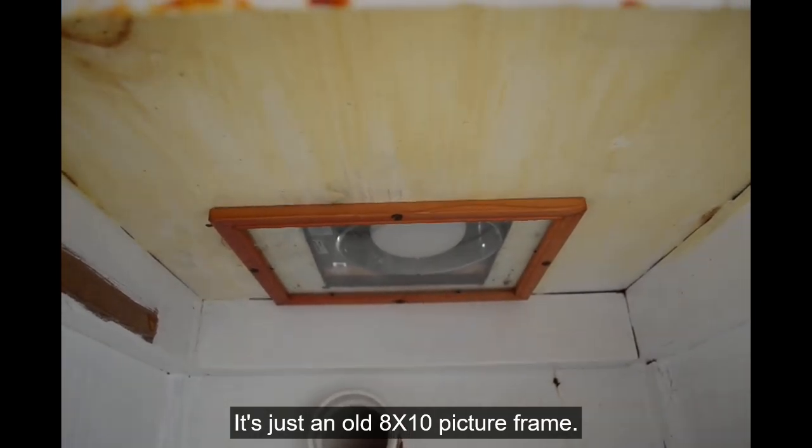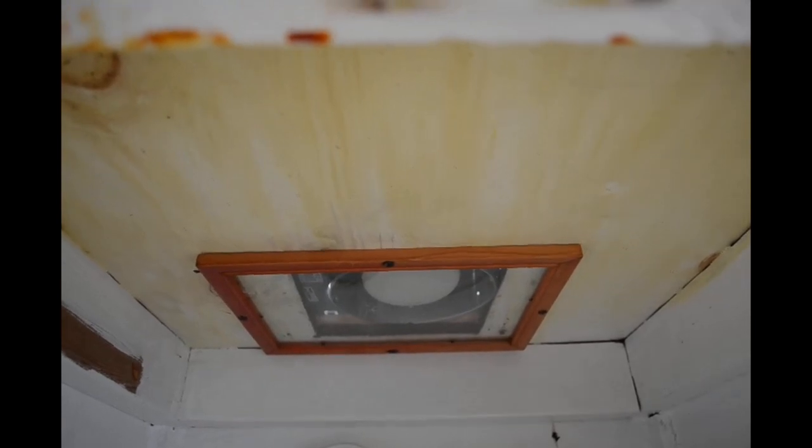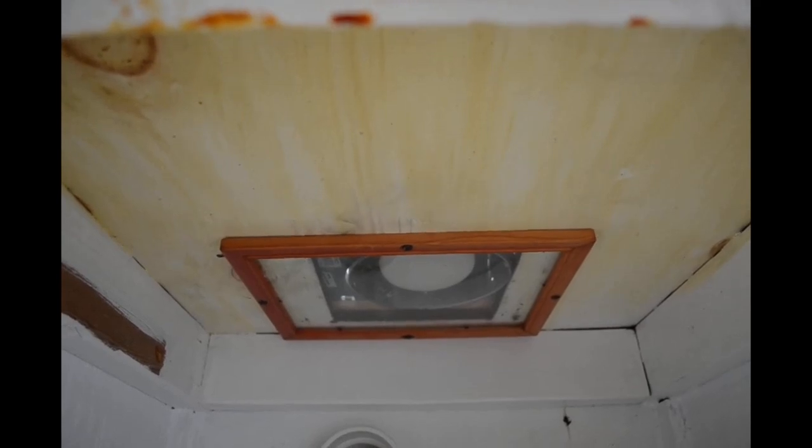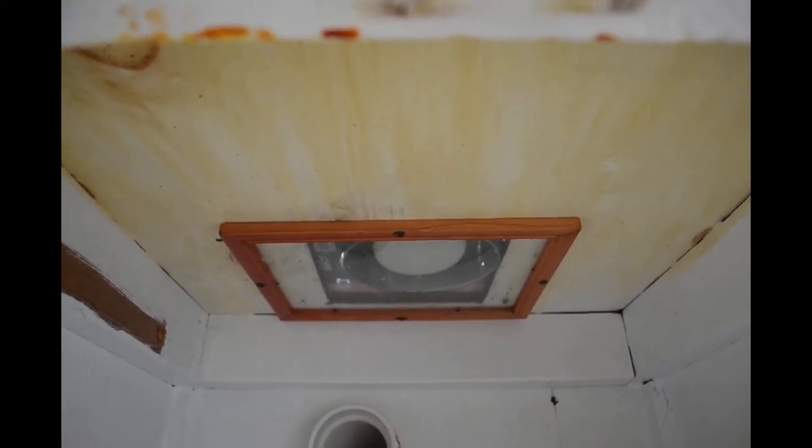I got to wondering about how I could mount a sheet of glass up there easily. I had this old picture frame laying around with glass in it and I thought I'll just screw this picture frame up to the ceiling of the fume hood to cover that hole. The light from the light will shine down through the glass and this will keep the fumes from getting up into the light and rotting it out.